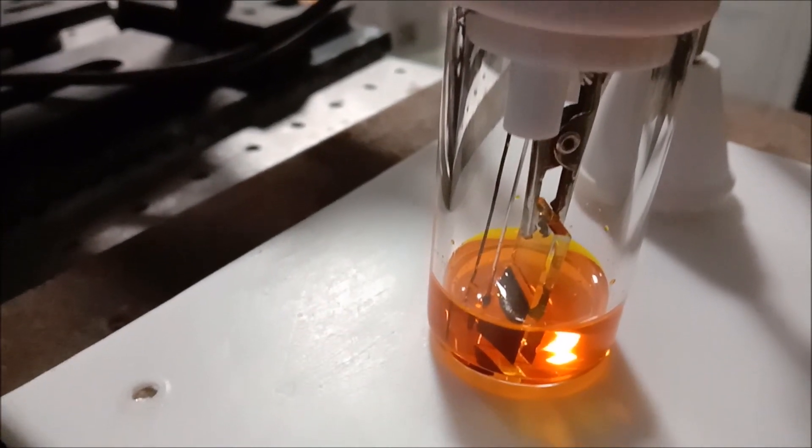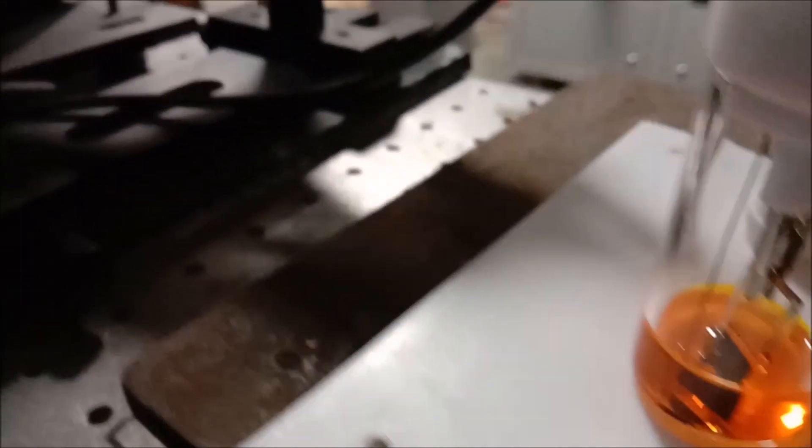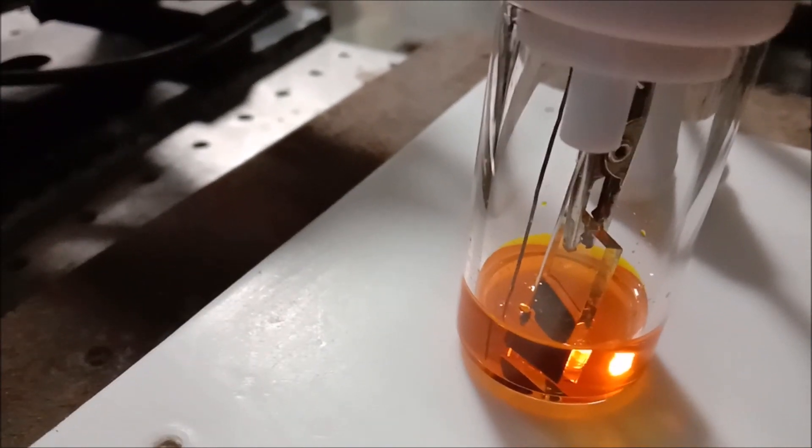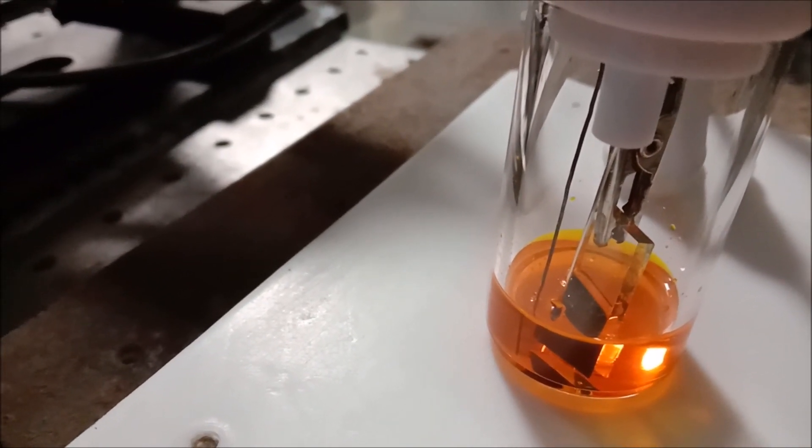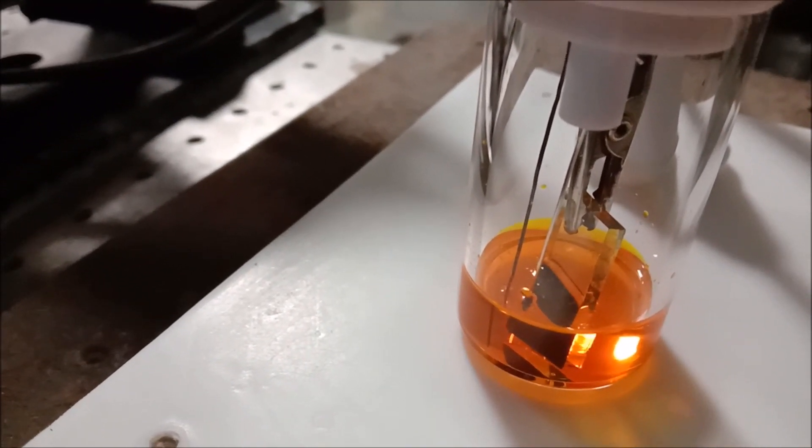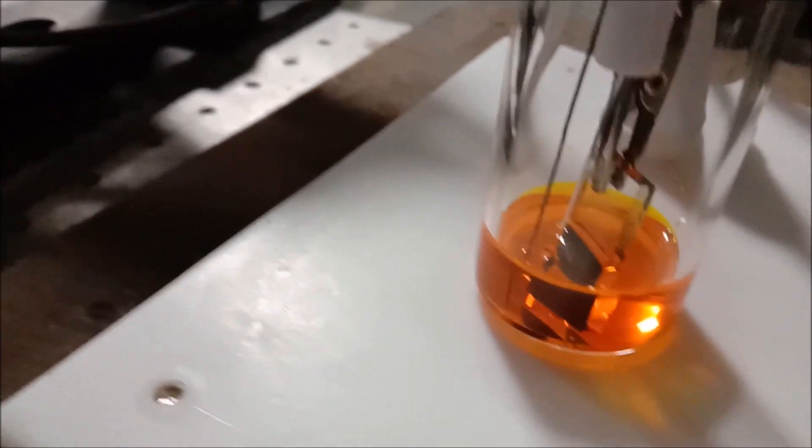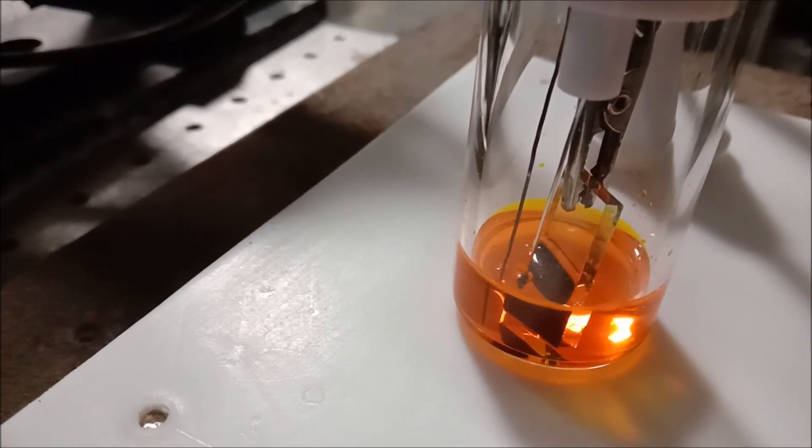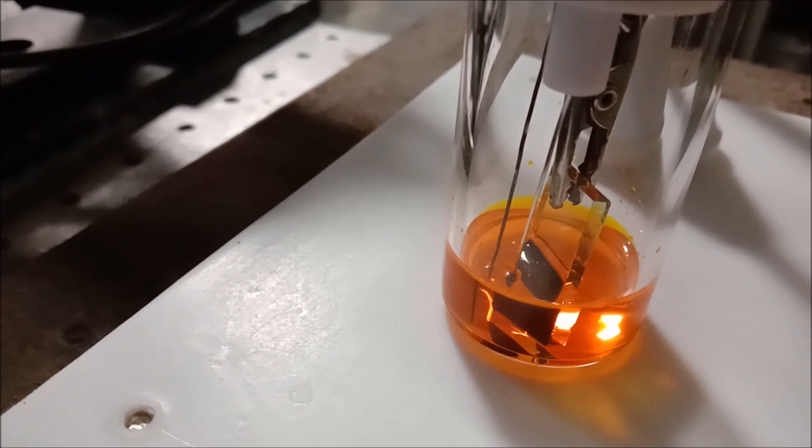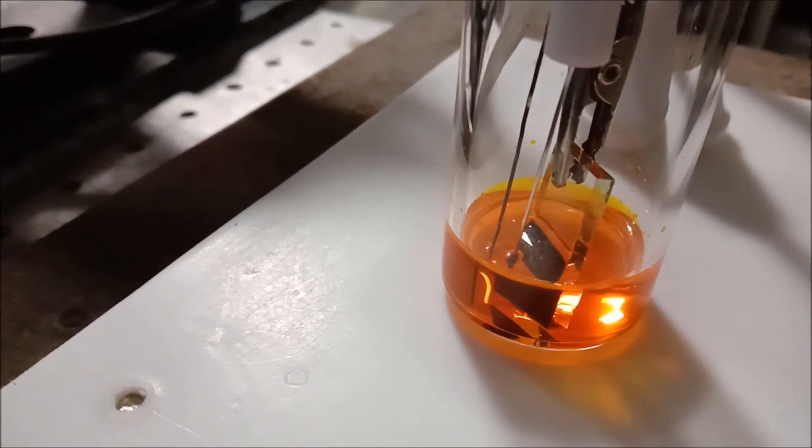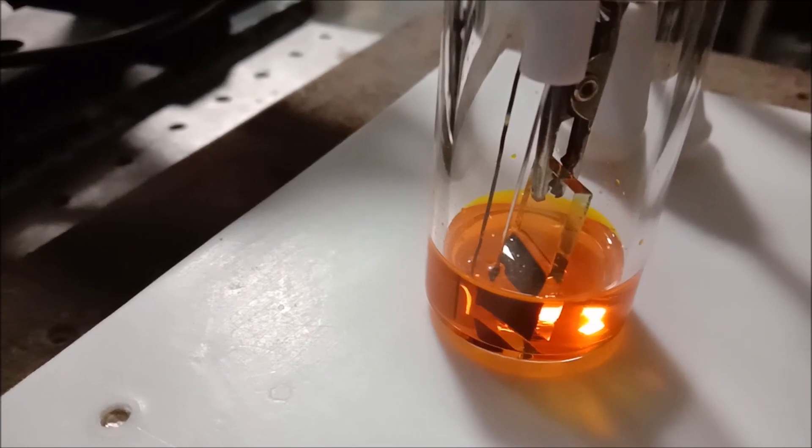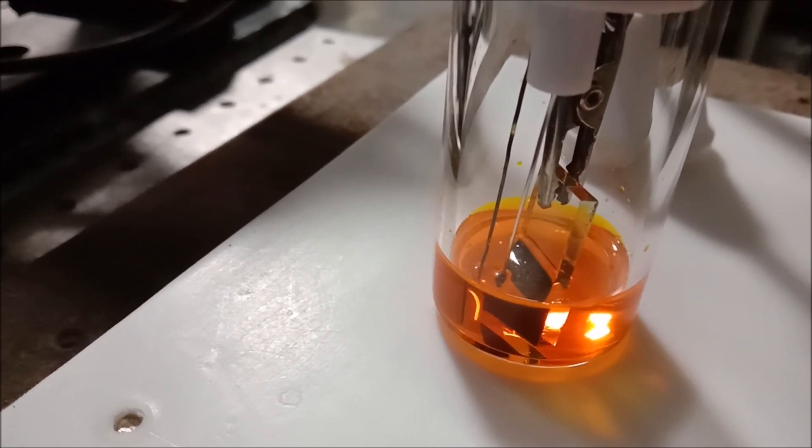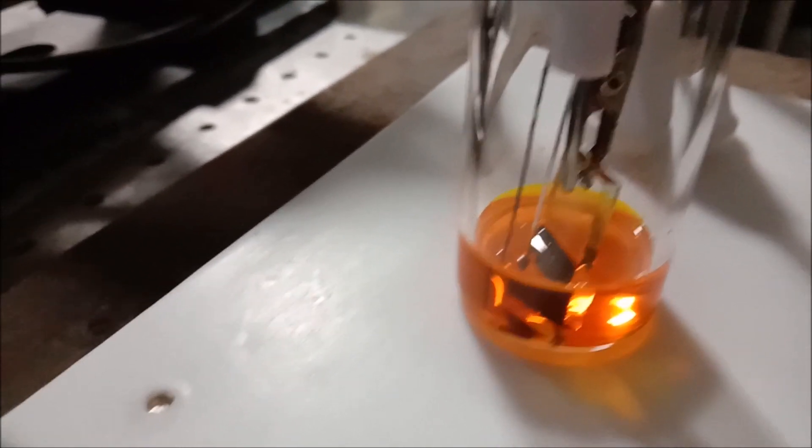You can see that now the film may come out of the FTO substrate because of the overloading. However, I am performing it for the first time so I didn't have any idea about it. I have chosen five minutes, now I think that five minutes is quite a high time.